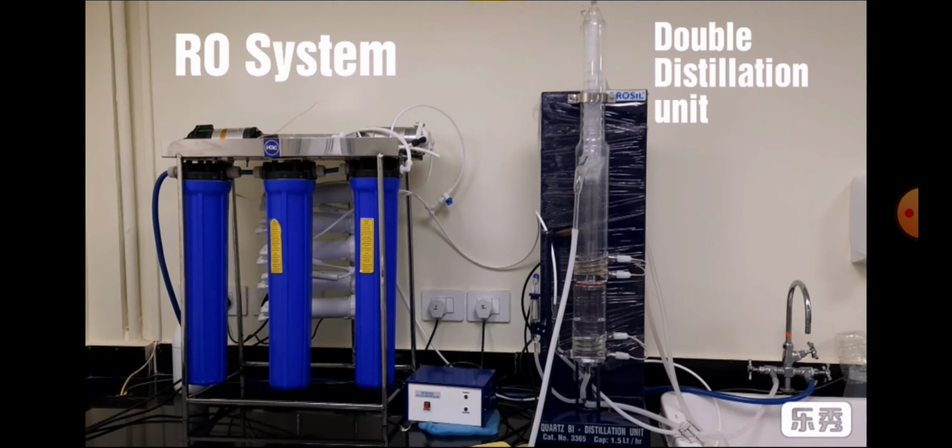Here, this one is the double distillation unit. Double distillation means that at first, in the first chamber, the first distillation will be done, and then in the second boiler the second distillation will be done, and after that we will get double distilled water, two times distilled water. So there we can get more purified water.